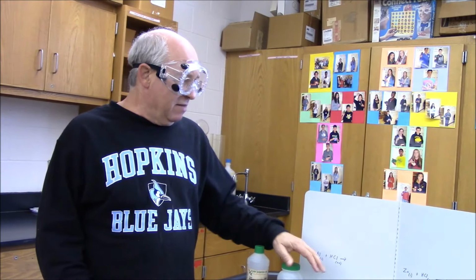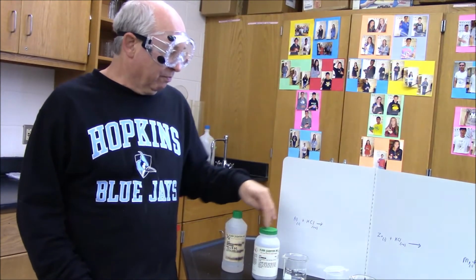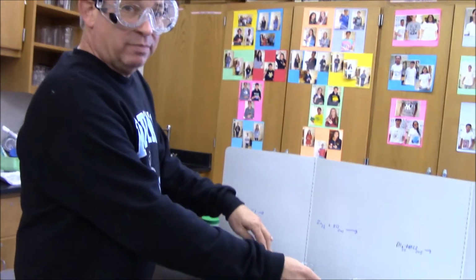Now we're going to work on part 2 of the activity series lab. If you look on your lab handout, most of the spots have already been filled in. Some of the reactions aren't safe to do here, and some of them are simply no reaction, and you don't need to see too many of those. So first we're going to do 3 reactions with hydrochloric acid: aluminum, zinc, and magnesium.